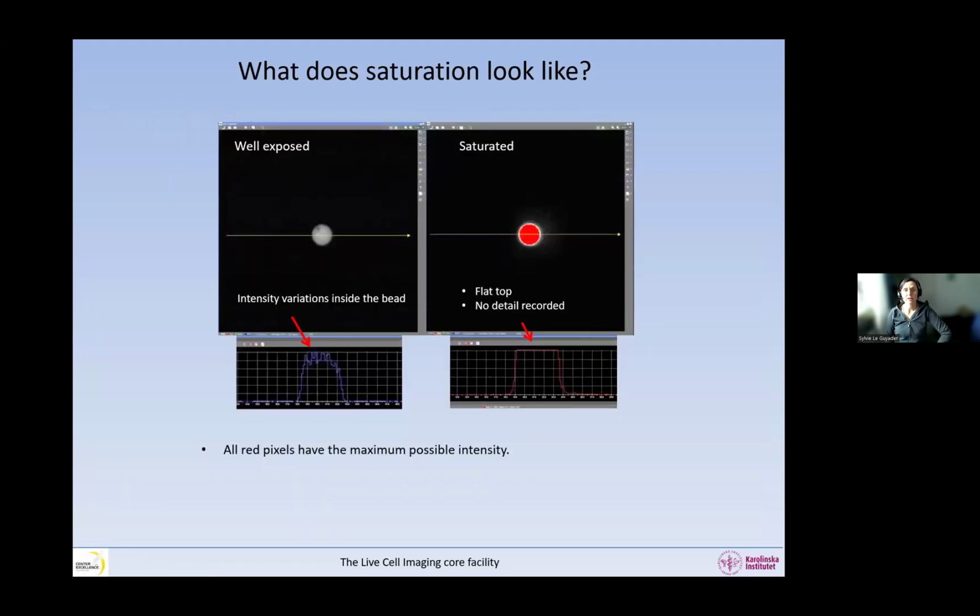So what does it mean that they are saturated? Here is a small fluorescent bead that is well exposed, and this one is saturated. We see this because we've applied the saturation mask. When we draw a line across the bead and look at the intensity profile, we see that in the well-exposed bead there is actually a texture. We can see some details; the intensity changes a little bit. This is reflected in the intensity profile, where we have some variation at the top where the line crosses the bead, and then it goes back down because we're in the background. If we now look at the saturated bead and do the same thing, the profile has a flat top. So there are absolutely no details recorded in this area, and this is why, when we look without the saturation mask, everything looks solid white and we see no details at all.